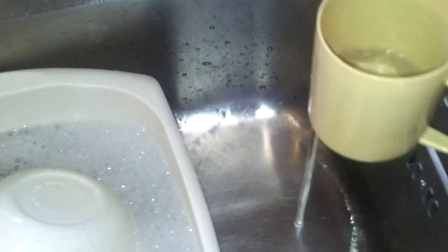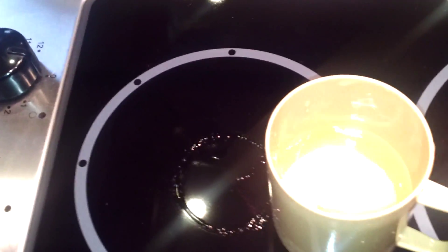So we're going to test a little bit of tap water, catch a little bit in a cup, bring it over here. We've got plenty of light. Turn the pen on, so we've got a zero at the moment.